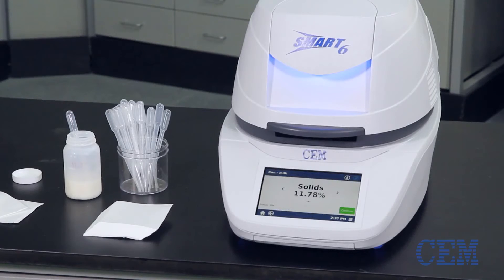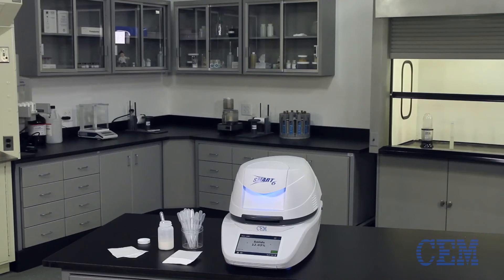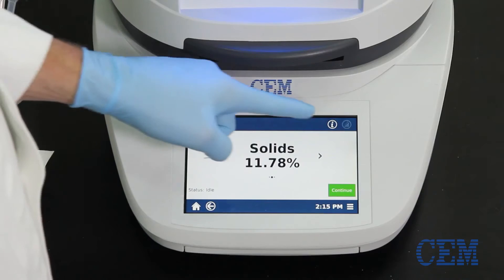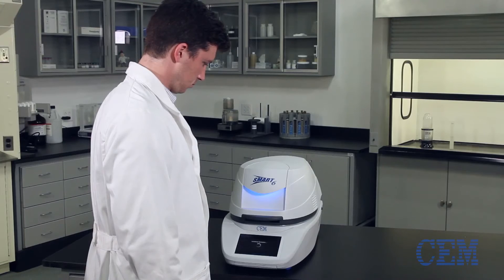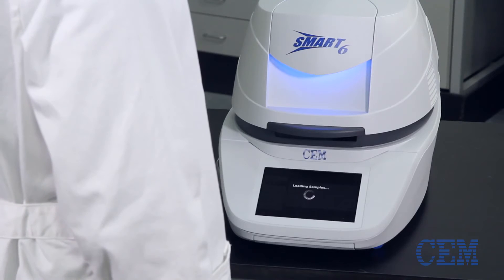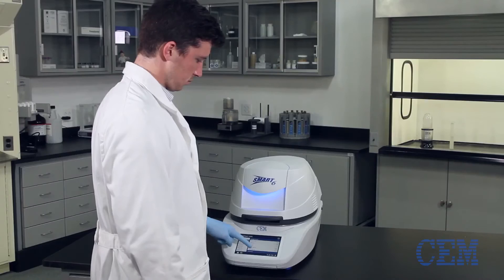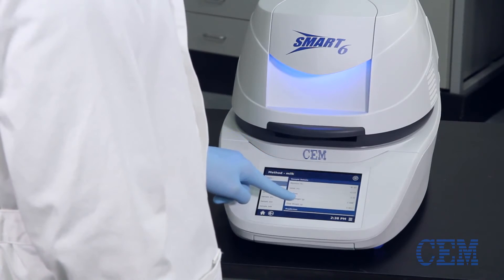After completing a test, you can quickly review information for that run, such as final results, run time and initial weight, by pressing the I button at the top right corner. Up to 999 previous results for the current method can be displayed and recalled. Results can also be sent to a LIMS network for easy data management.